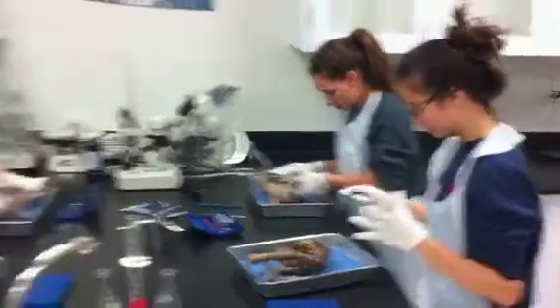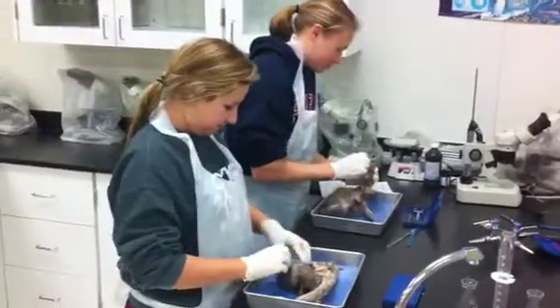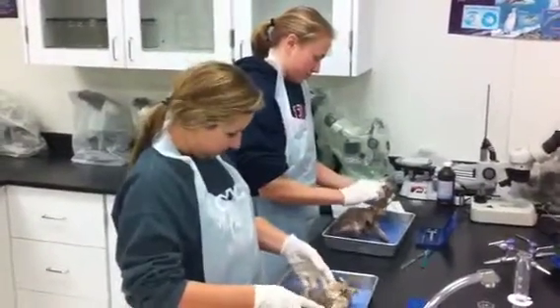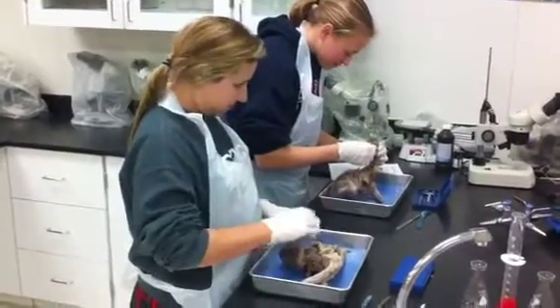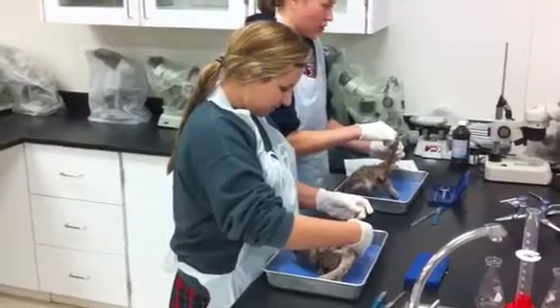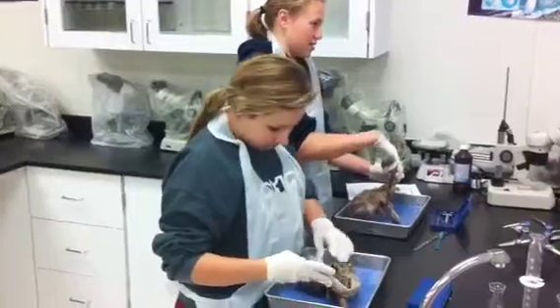It should be like this. I feel like my heart has a lot of excess material on it. Can I take some of it off? Once you get it oriented, then we'll start. They should have a fork here. I'm going to come around and make sure you've got it. I'm going to stick my finger in it. Your heart is giant.